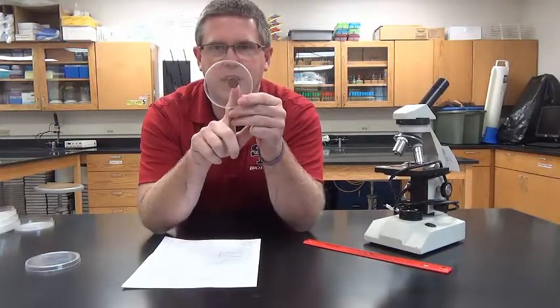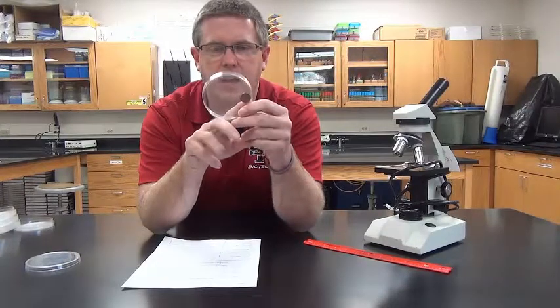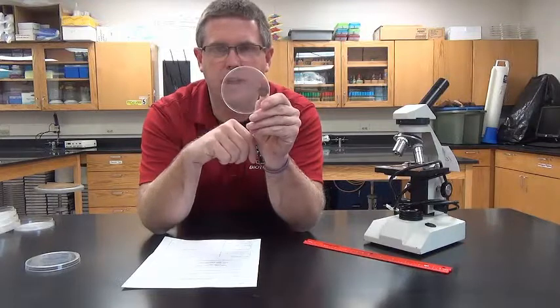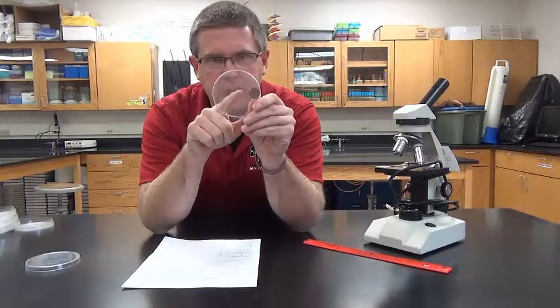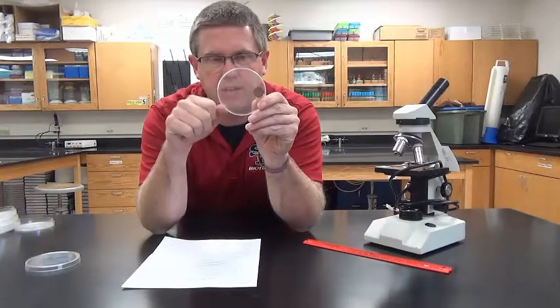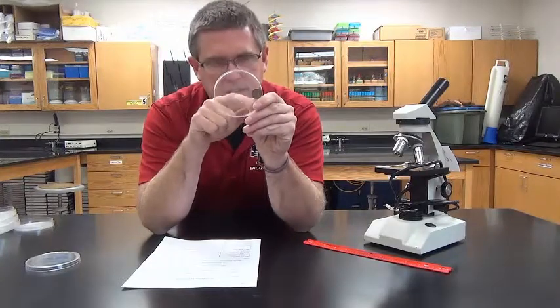It's much easier if I slide the penny to one side. Then I can visualize how many microorganisms it would take side by side to get from one side to the other, so that I only have a fraction on this side by starting at the side.